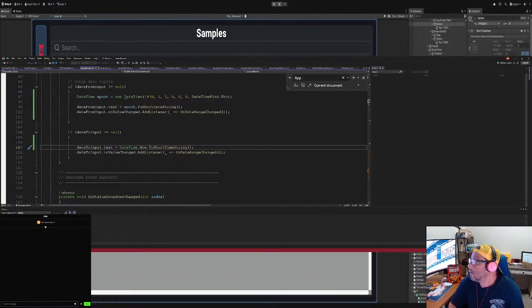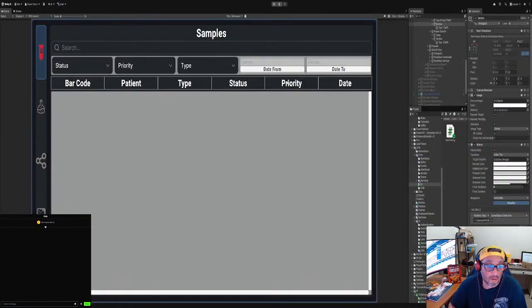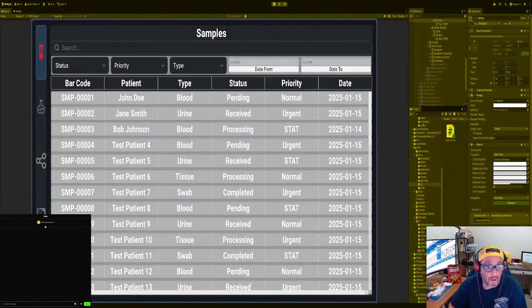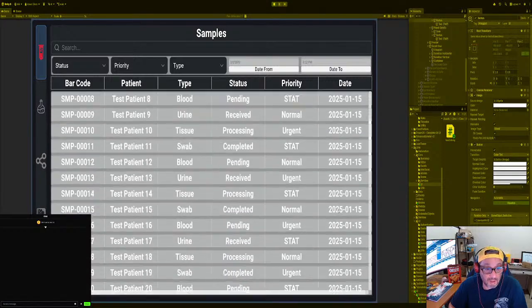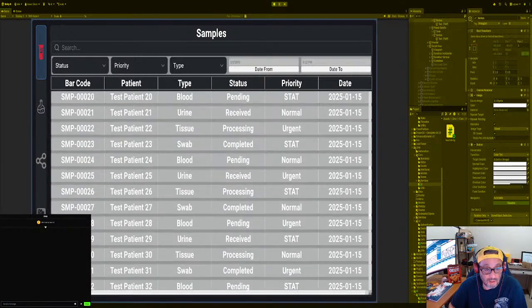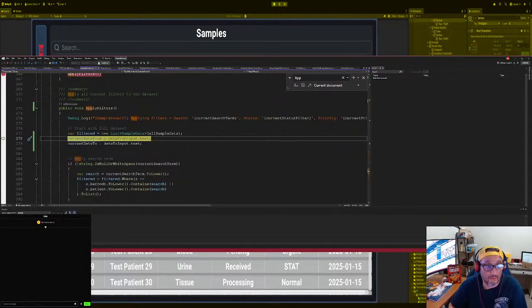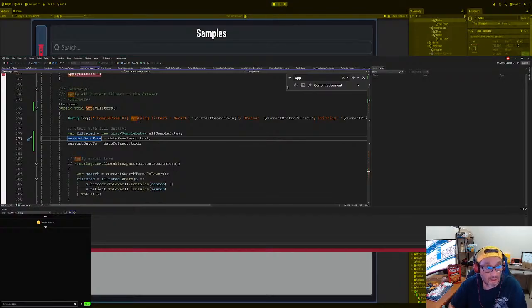Okay, it's loading up here. And let's just give it a try. Another one. Okay. Okie dokie. All right, so everything seems to be, so let's do a date before from to, okay. All right, good for you. All right. Oh, you see? Right there. It messes it up. Oh, 12. Oh, yeah. So we did do a date before one or a date after.